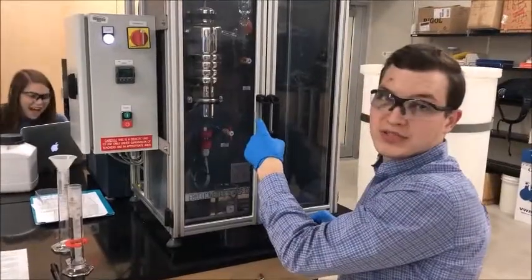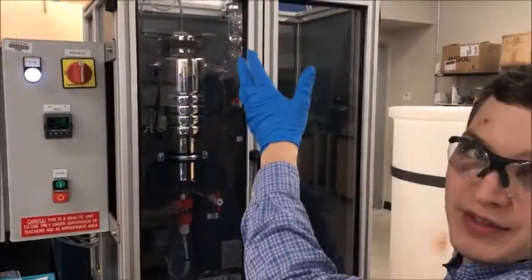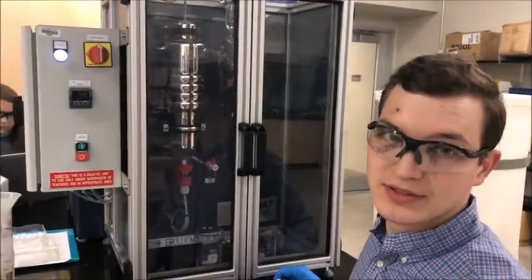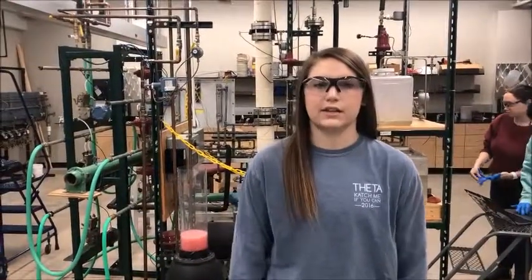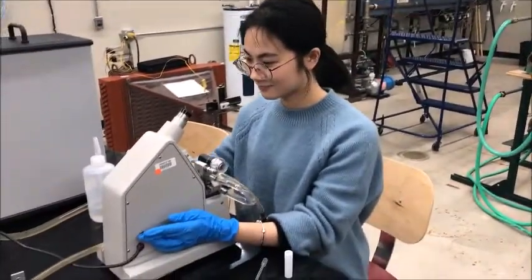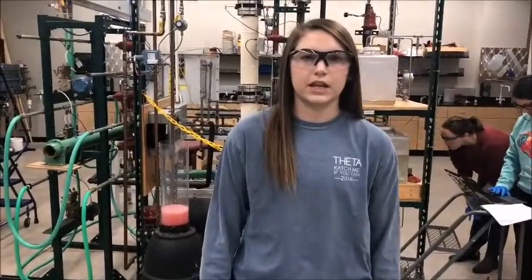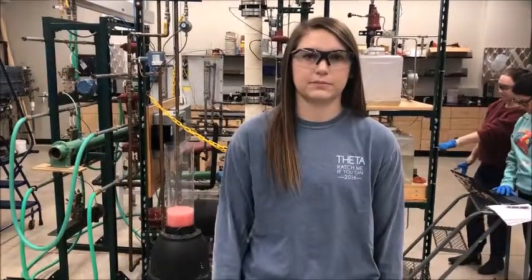Wait for the bubbles to stop being produced in the column, meaning no more vapor is coming off the top. Then you can open it up and pour in the rest of the fluids. Each sample is then analyzed using a refractometer as laid out in the composition analysis booklet. If the reading is above 1.3900, the solution must be diluted.